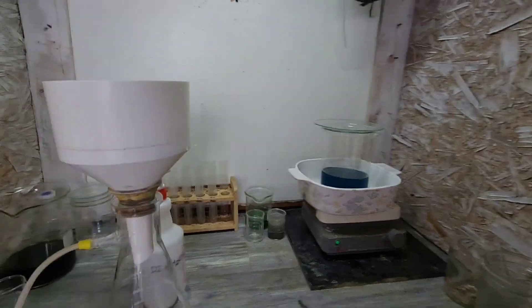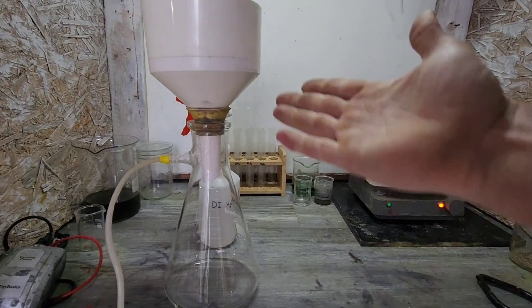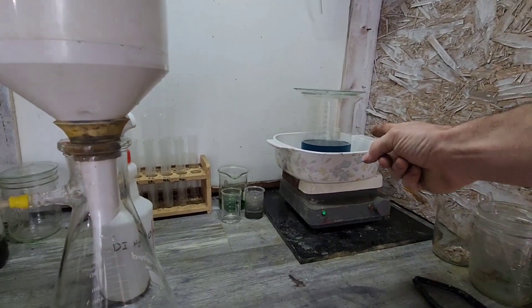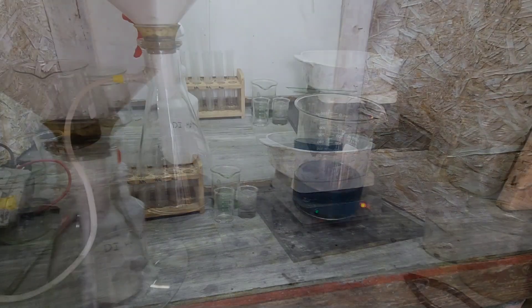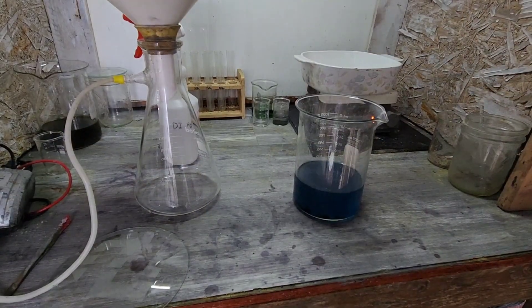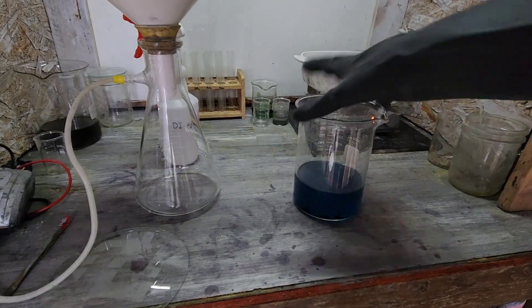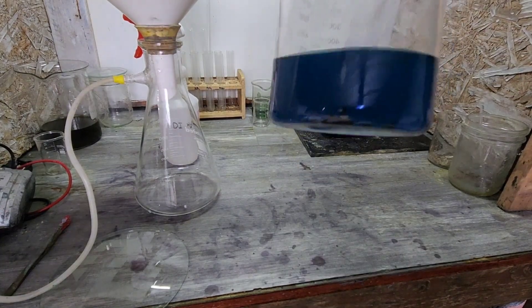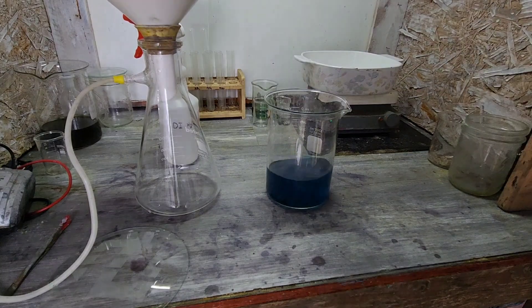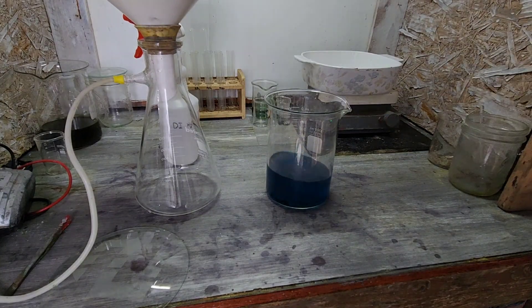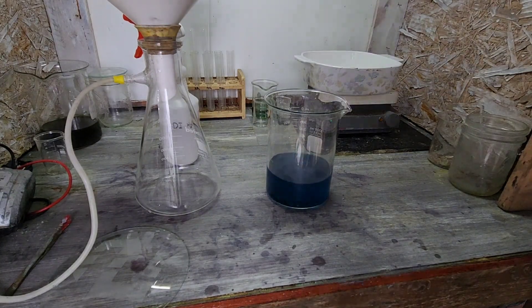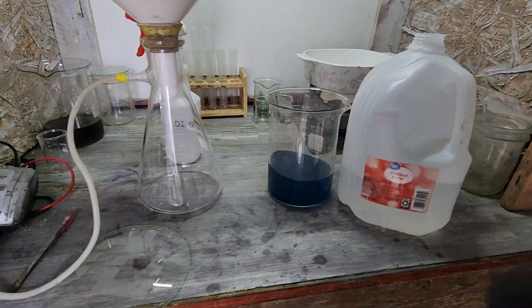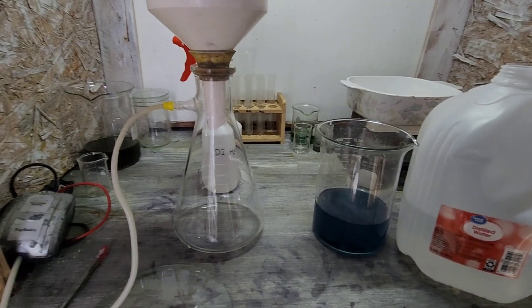And over already, got the flask nice and prepped, so we'll be ready to rock and roll as soon as we get that silver ready. All right, and there we have it. Everything is dissolved. Nothing hanging out at the bottom anymore. We had zero fumes coming out, so I think we're in the clear in that department. So it is time. Start filtering this bad boy out.